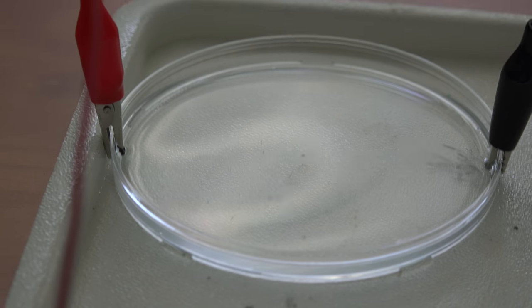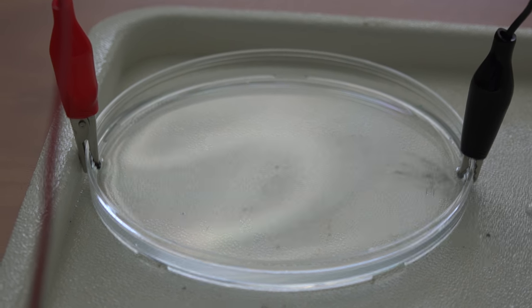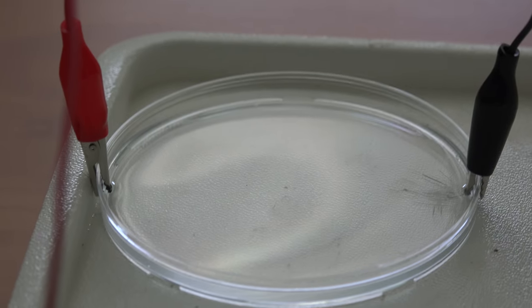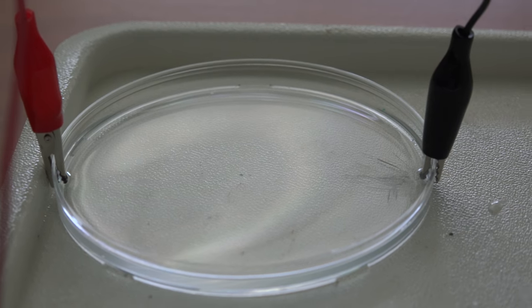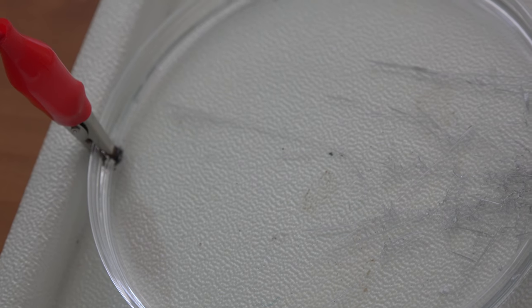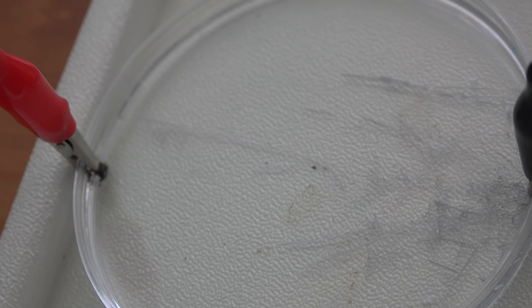Reaction is occurring. I'm guessing it's precipitating out the tin — it first starts at the end of the black clip, and then since it can also conduct current, it becomes the focal point of more tin accumulation, moving across the petri dish. Almost halfway across and it's been less than a minute. It's interesting that in a straight line it's not headed directly for the red clip, rather to the side.